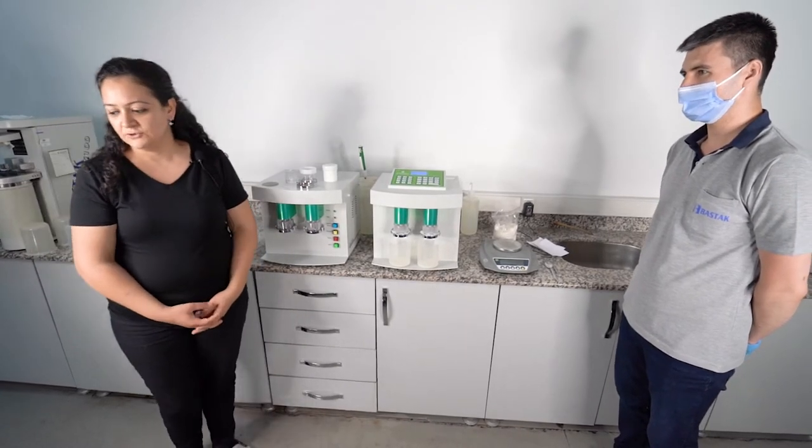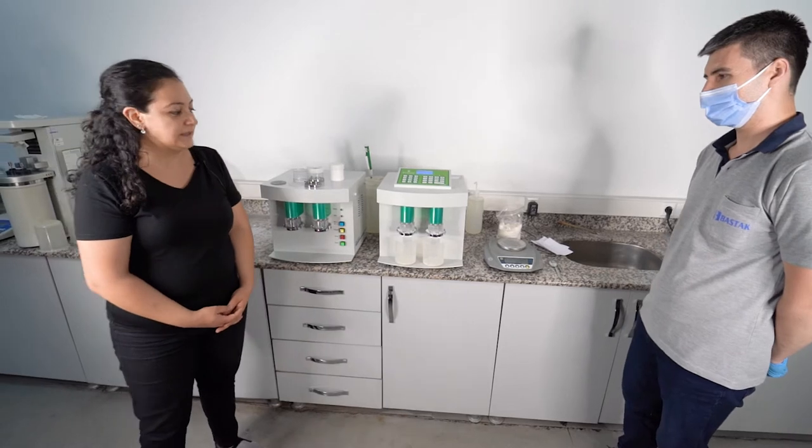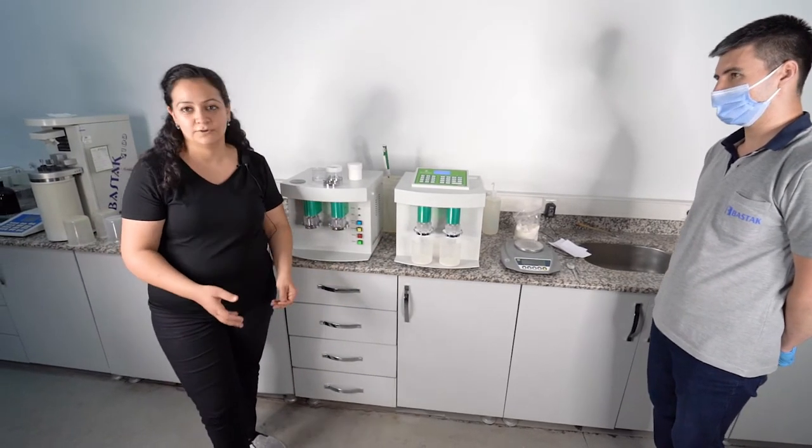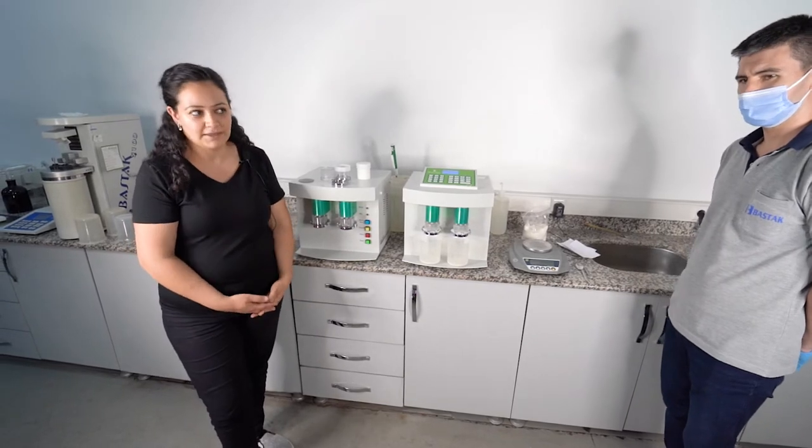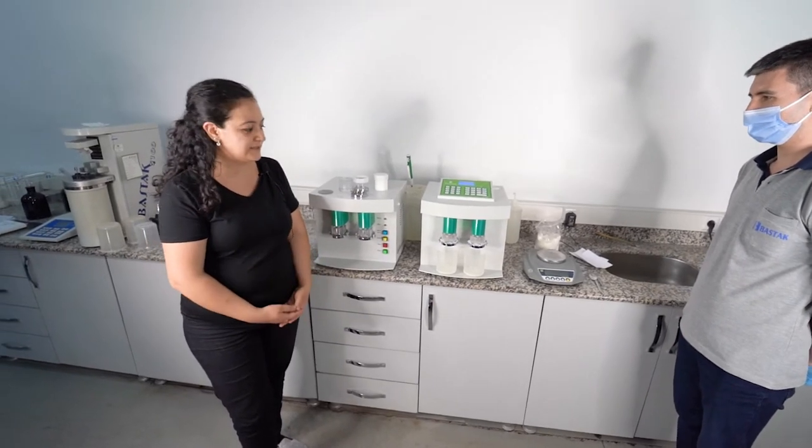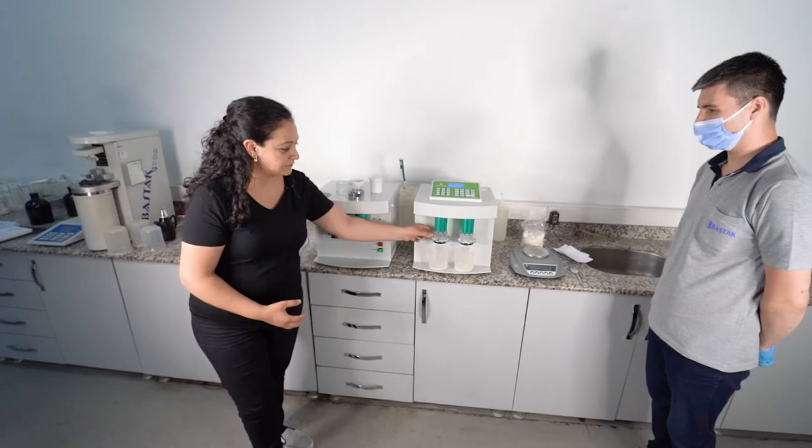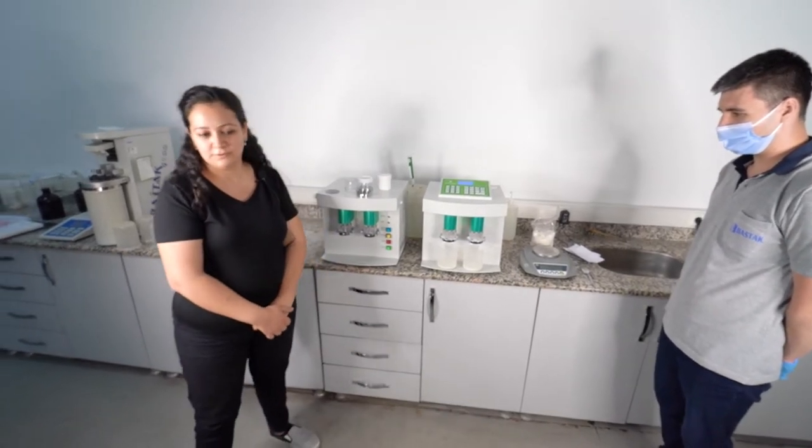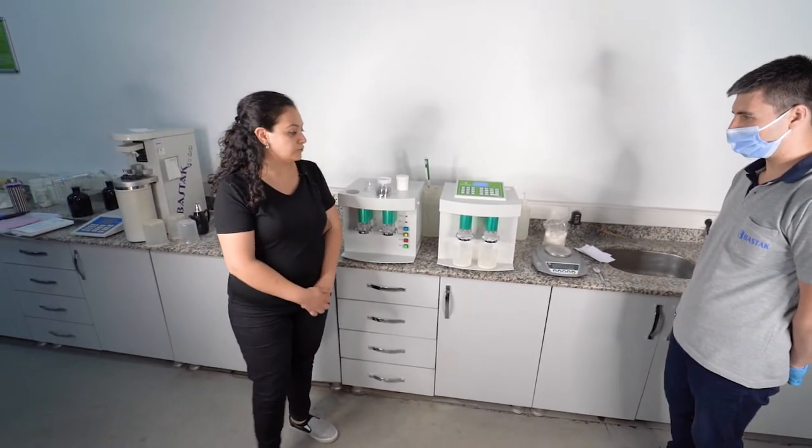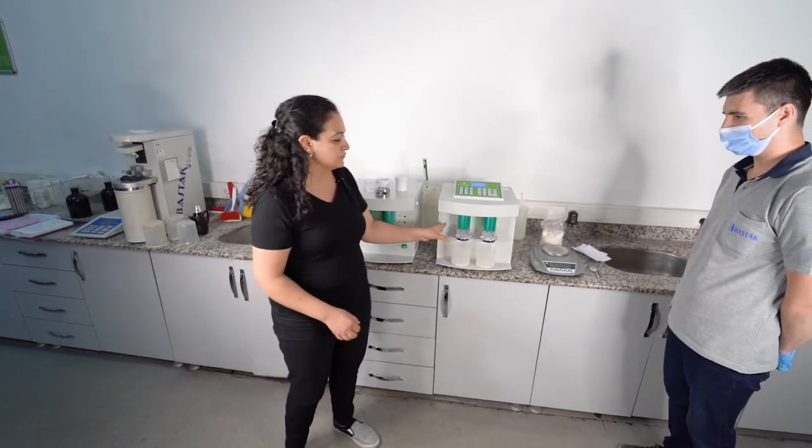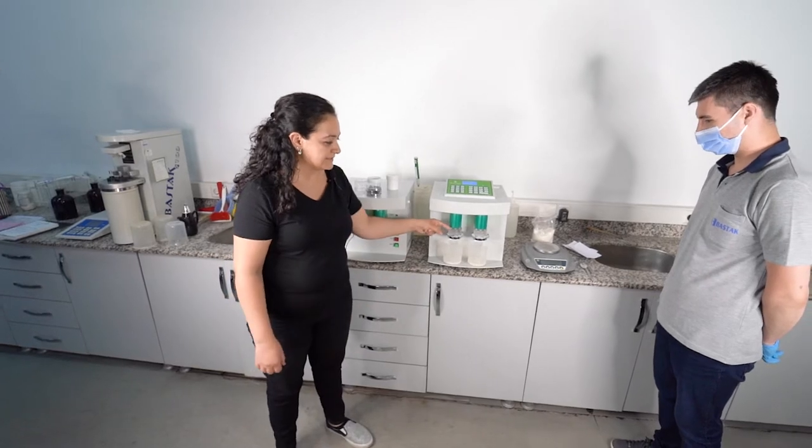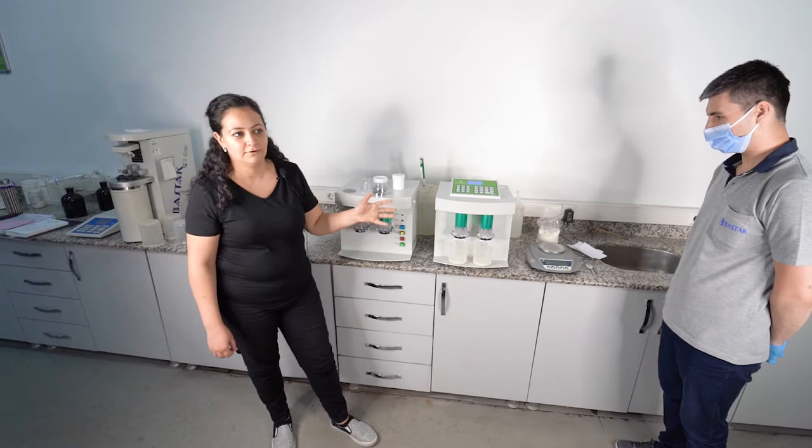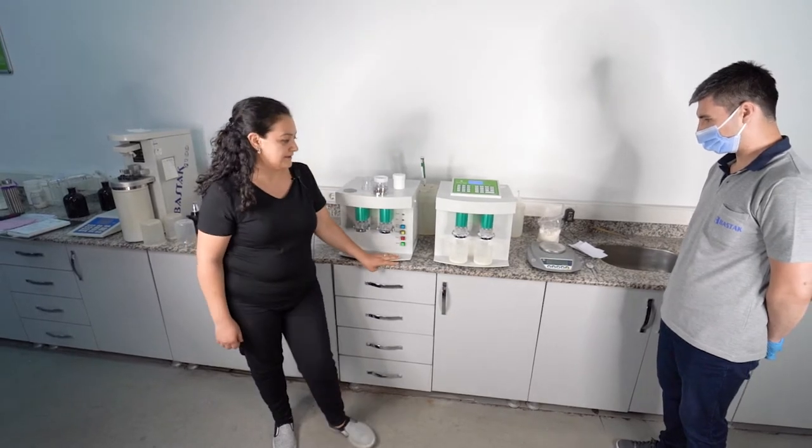After the test you should clean your machine. Sometimes with dirty material it is difficult to clean it. After a few days or after a few weeks, it is not possible to take out these materials. You shouldn't use chemical materials or alcohol during the cleaning, just only water. These are plexiglass materials; it can be broken if you use alcohol or other materials.